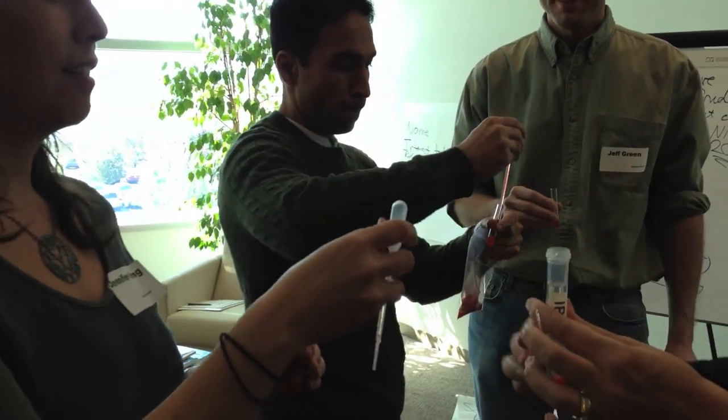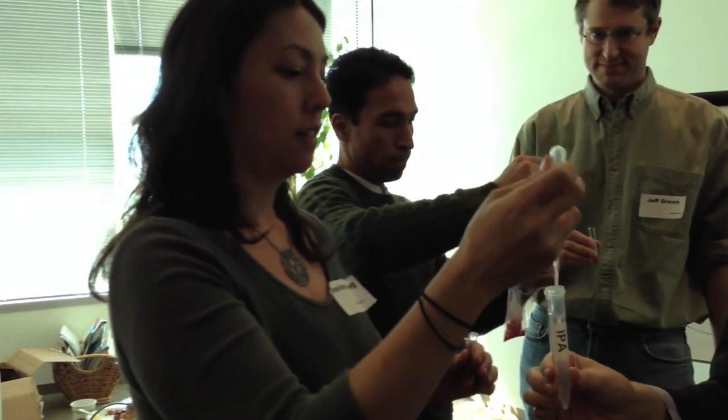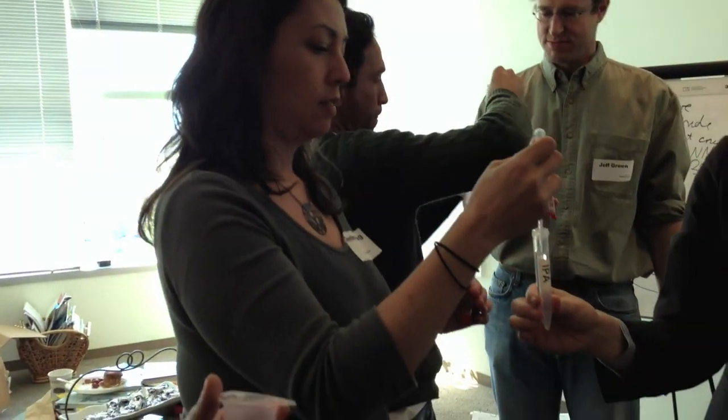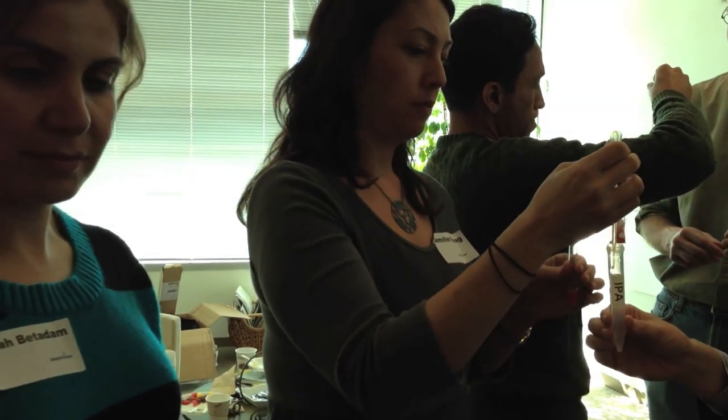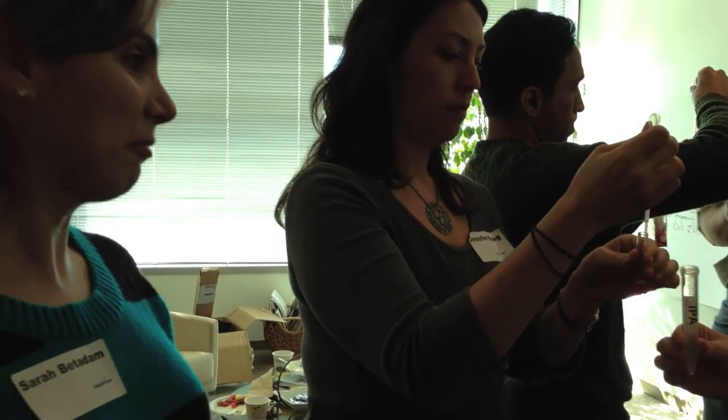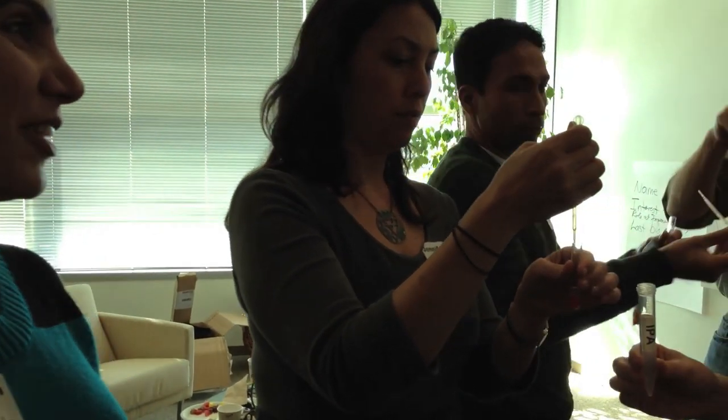You might be first. There you go. Thank you. Can we add it to this one? Do you want to do anything? Yes. I wonder if you'd be able to see it just because of the - too much. Yeah, but you could try it if you want. There's no reason not to. I'm just curious. Yeah, start popping.